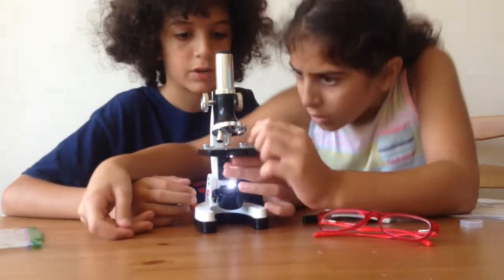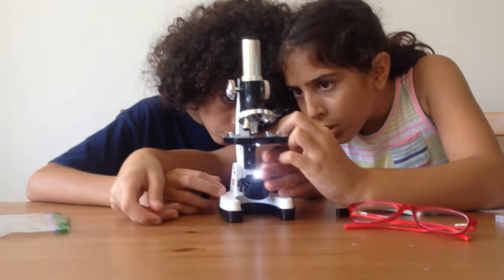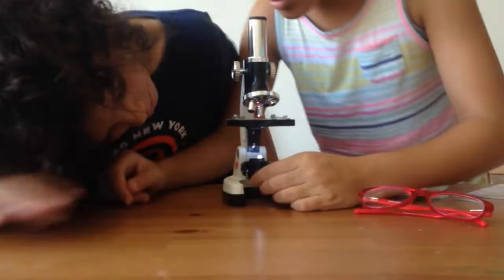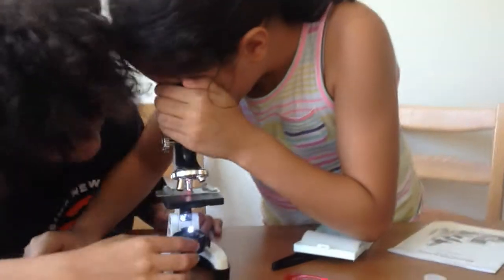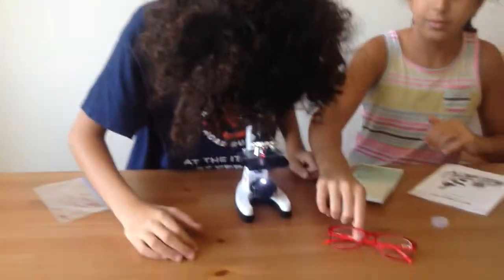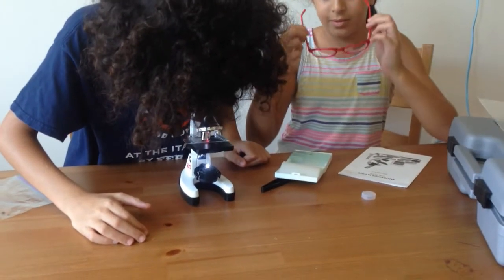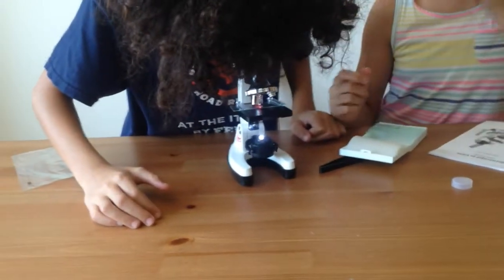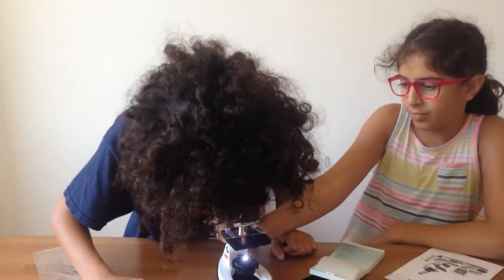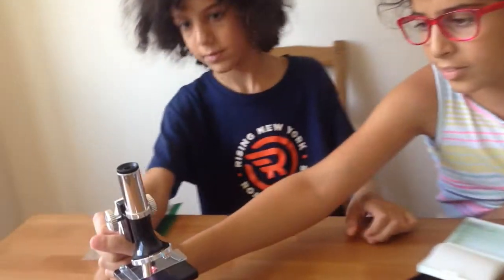It's the color from down here — go look, there's color. I'm just going to see. Ooh, it's red! Really? Let me see. Yeah, it's red. Oh, I can see it! Can I see? So hairy.